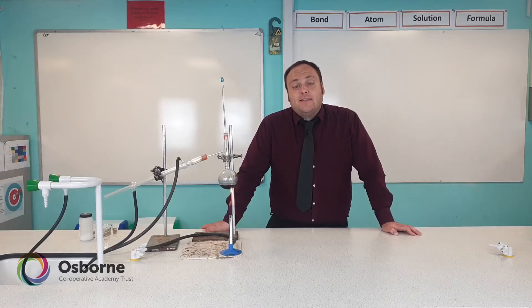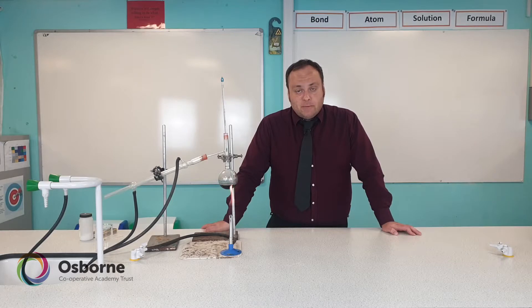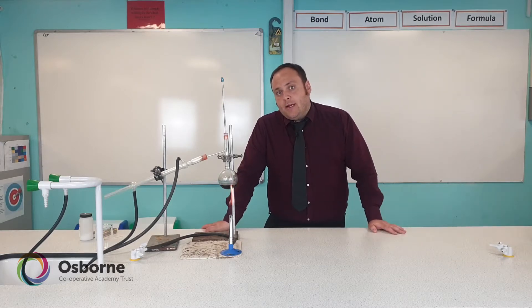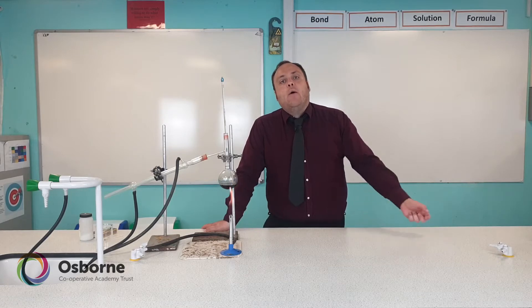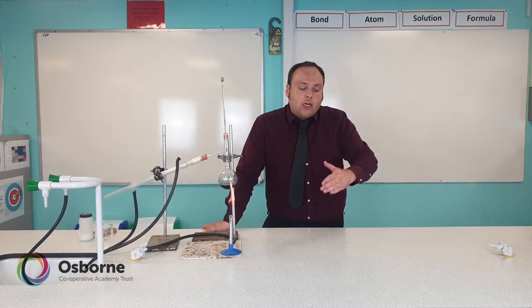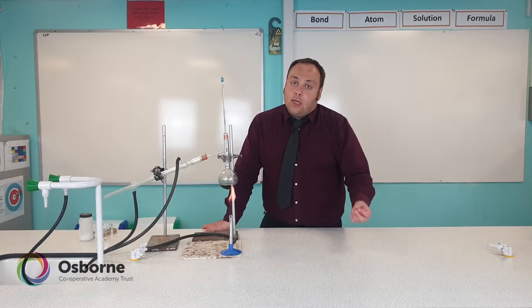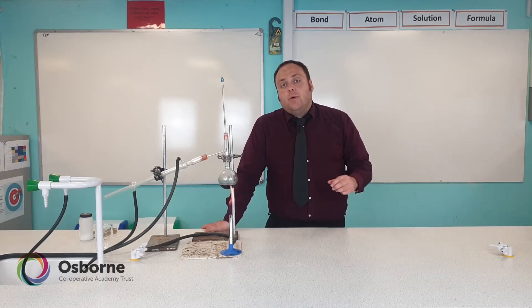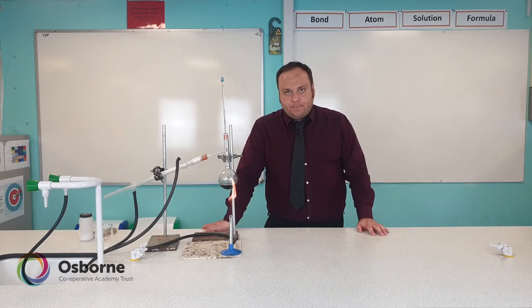Distillation is another process that scientists can use to separate a mixture. In our mixture that we're going to separate, we've got ink and water mixed together and we're going to separate the water from the ink. So we're not going to separate the individual chemicals that are in the ink like we did for chromatography, but we're going to separate our ink and water mixture.